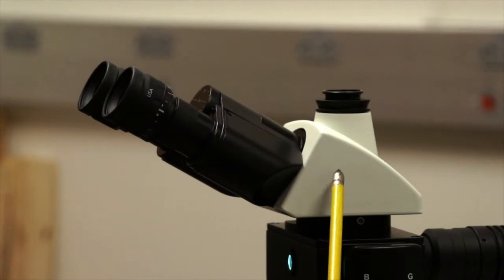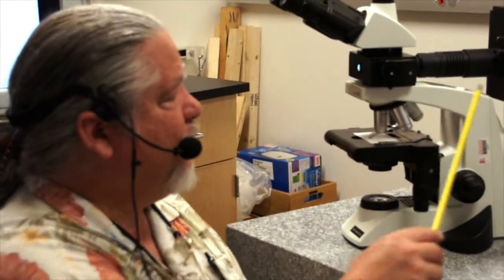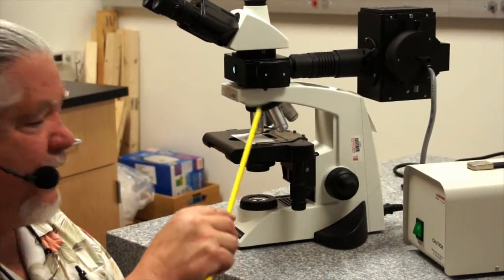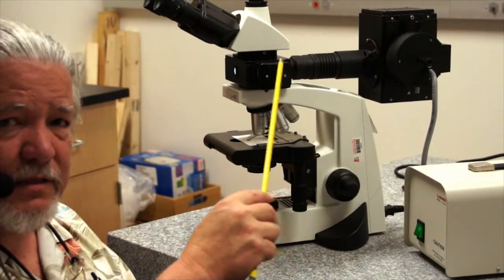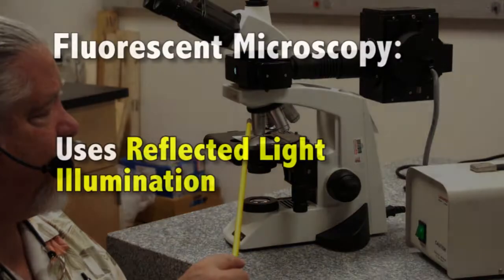We also want to discuss the illumination coming from above. We have transmitted light illumination through the microscope, and we also have reflected light illumination. In fluorescence microscopy, we use reflected light illumination.